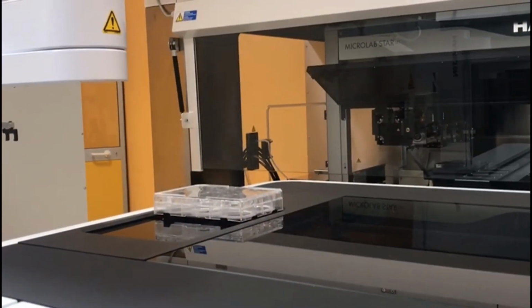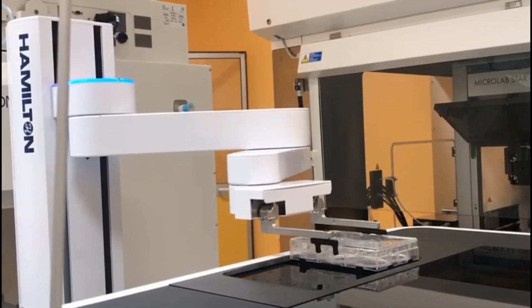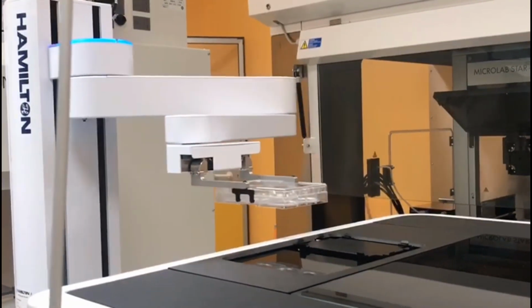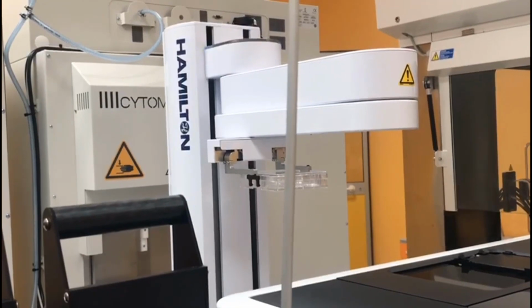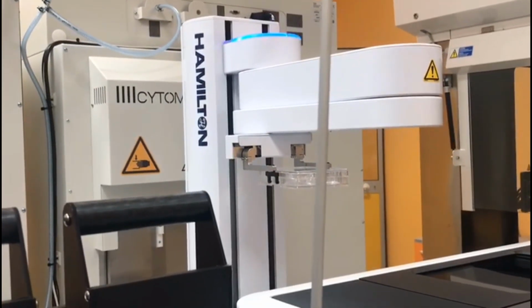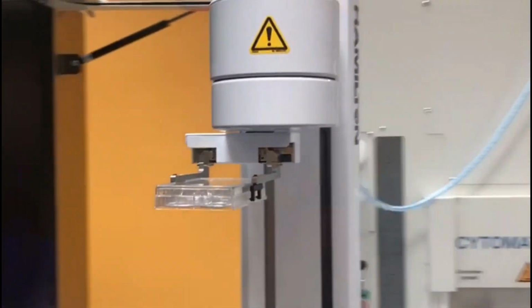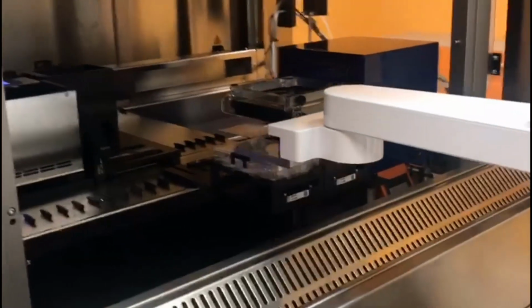Thanks to the open characteristics of GalileoTMAtic, it is possible using a robotic arm to take the microfuge plate and place it into an automatic liquid handling system, Hamilton, from which several processes can be made, such as reagents aliquoting, DNA or RNA extraction, capping and decapping, tubes and plates centrifugation and NGS reaction preparation. The robotic arm can transfer the microtiter plate into an incubator or to additional image platforms.